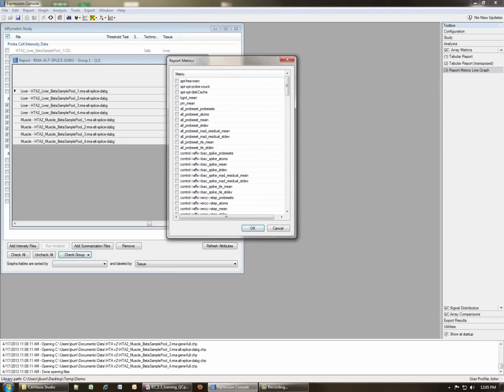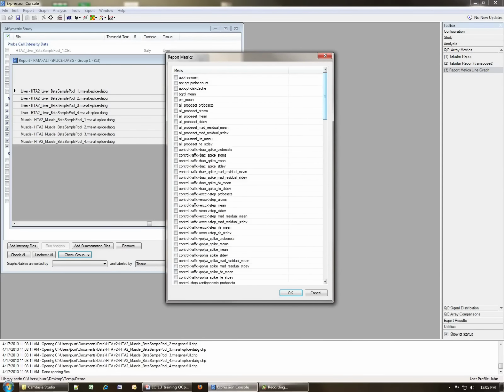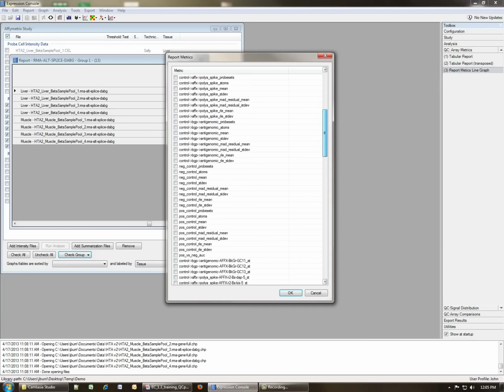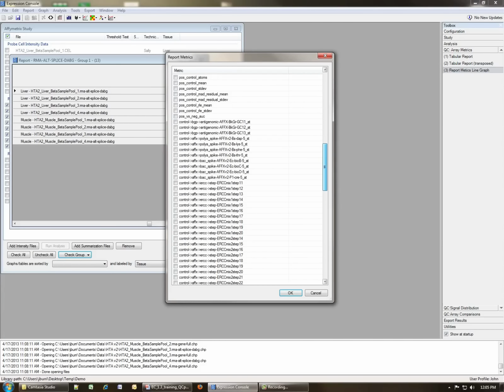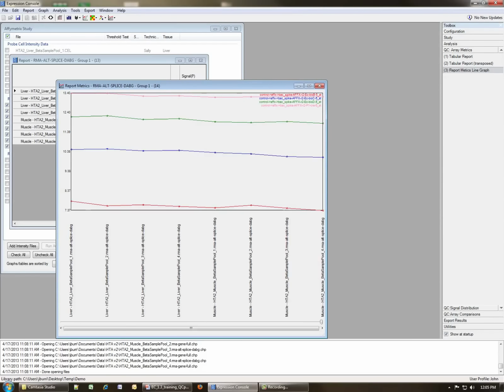Here we get a pop-up that allows us to select which metrics we would like to see in a line graph. Any of the metrics that are available in the column headers are available for display. So for example, let's scroll down here and we can see the controls, and we have the spike-in controls for the BioB, BioC, BioD, and CRE. If I select all of them and click in the little checkbox, and I click OK, now a line graph will be displayed that shows those metrics here. And again, they're color-coded with the legend up here in the right.